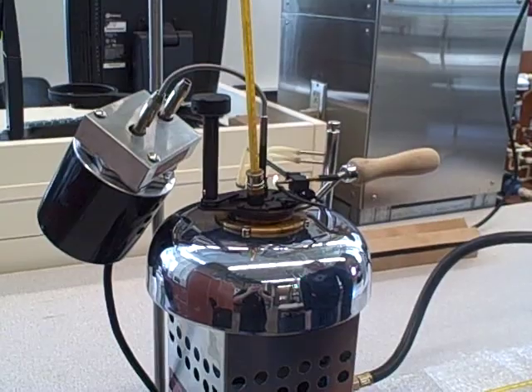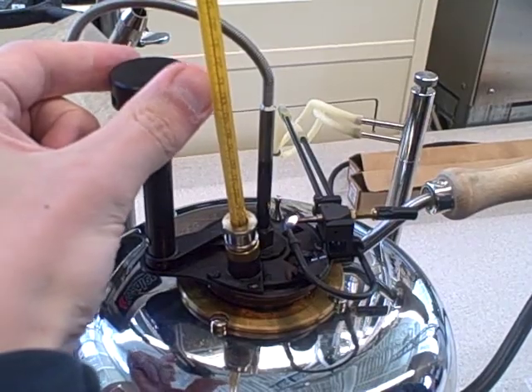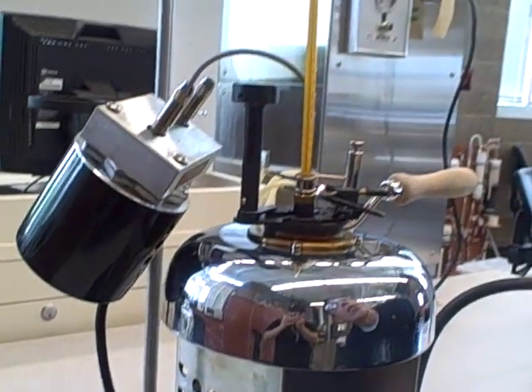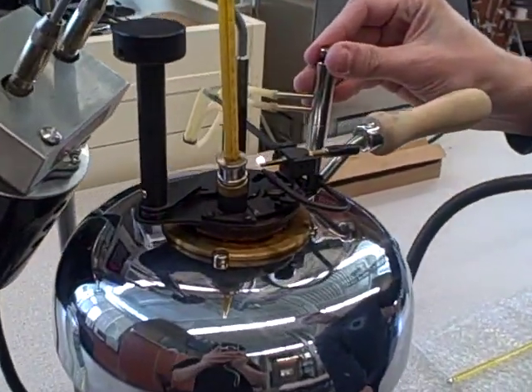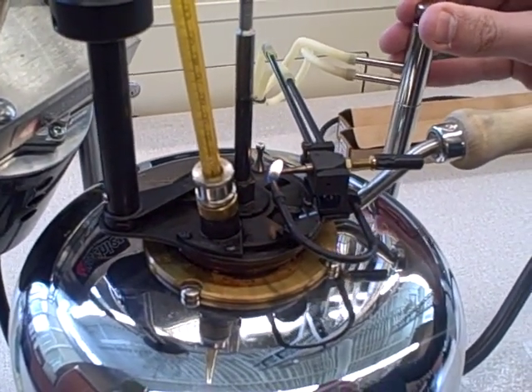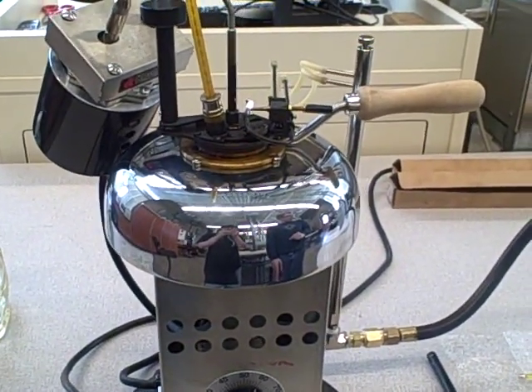When you go to test the flame, turn the stirrer off. And you turn the knob, which lowers the test flame into the cup — just a quick turn like that — and we did not have a flash point yet. So you restart the stirring device and wait a couple more degrees. We are at about 188 now. I will turn off the stirrer and dip it again. You probably didn't see it, but we had a tiny little flash there — it helps to do it with the lights off. You just go up in multiples of two up until you get 220 Fahrenheit, but in this case we already had it at 188.